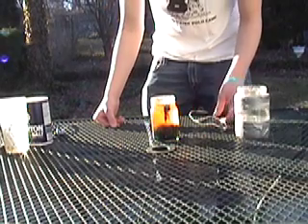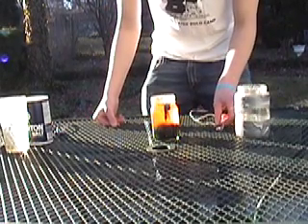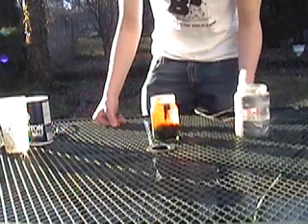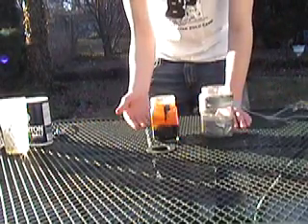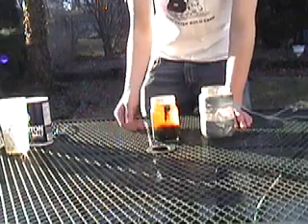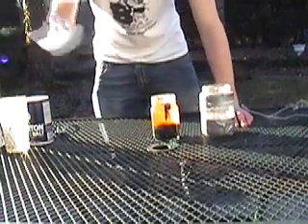You have to replace a 9-volt battery. This converter is constant power — you can run that as long as you want, basically, unless your thing catches on fire, which I don't recommend. After you have this, you're going to want to filter. This is basically the last step before drying.